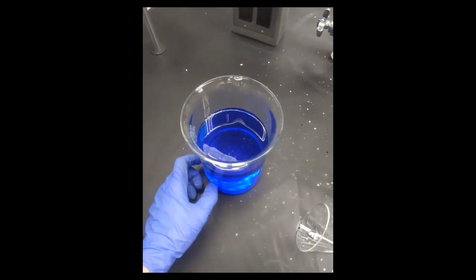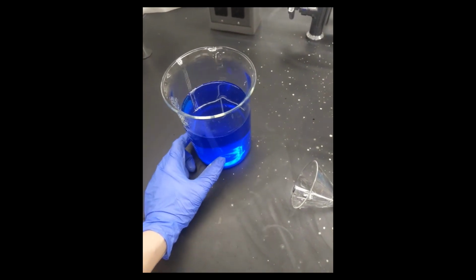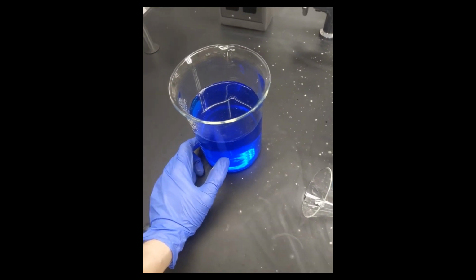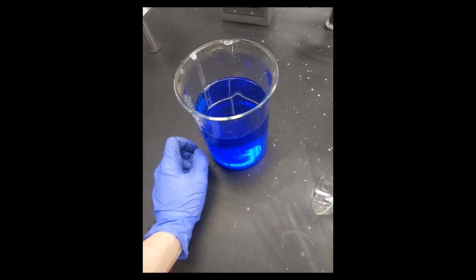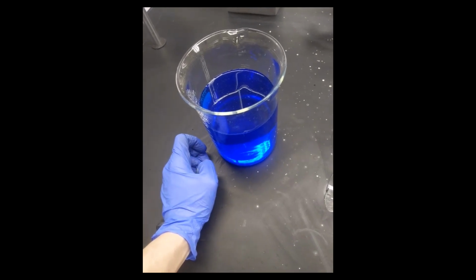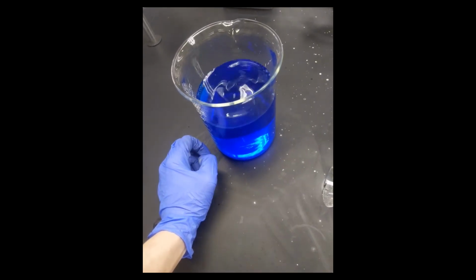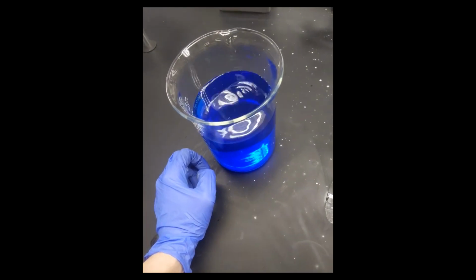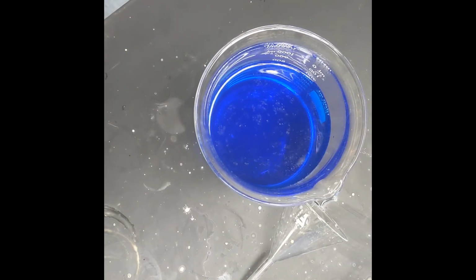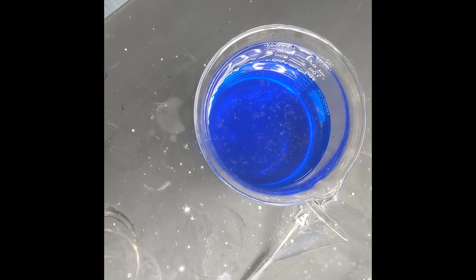What I'm gonna do is I'm going to crash out any remaining silver nitrate just quickly with chloride, which is what I really should have done in the first place. I'm gonna add some chloride. You'll see it'll get white if there's anything in there. And then I will reduce the copper back into the metal, decant the rest, and then I'll be able to dispose of it. Now we get a chance to see whether there's any remaining silver nitrate.